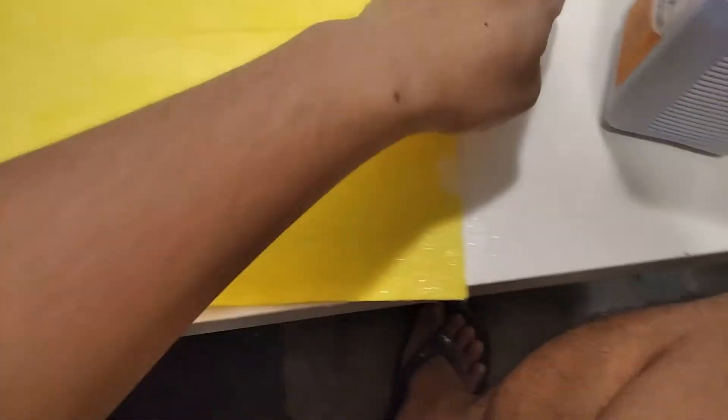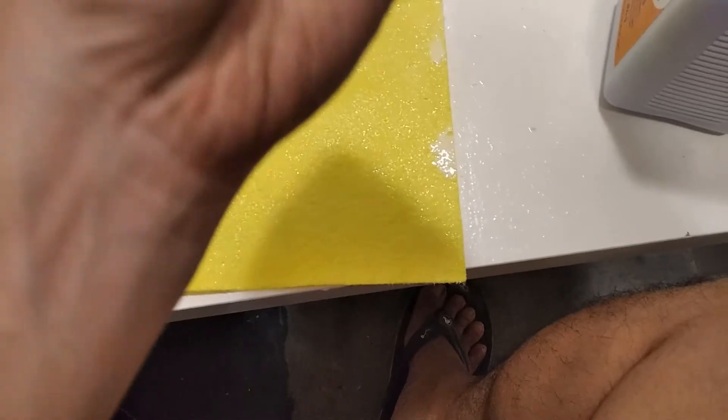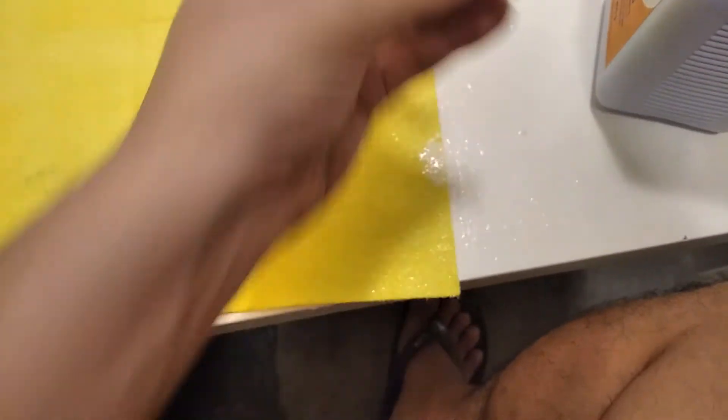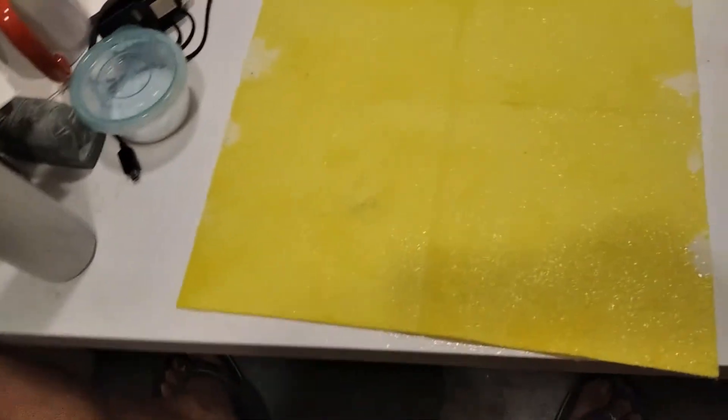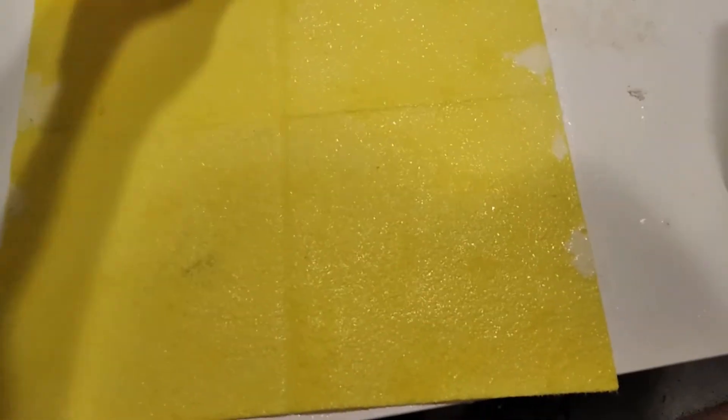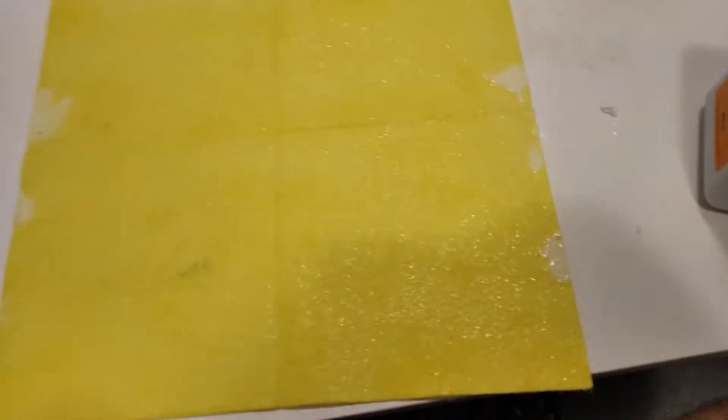Anything that's also on the table is easily removed. There's a cool fun trick you can do. If you mix this with water and pour in some borates, you get a slime, but that's not the purpose of this video.